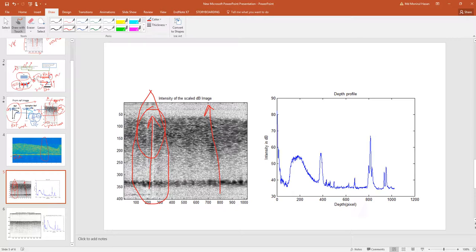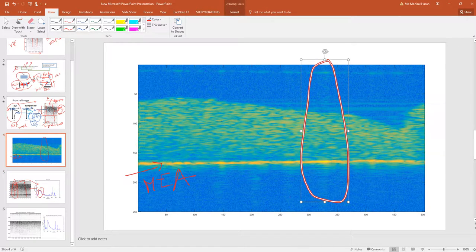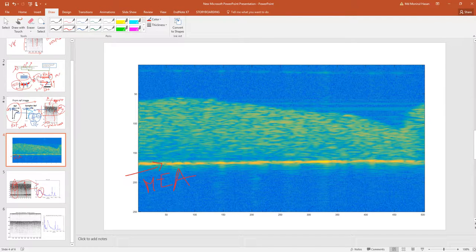If you look at the depth profile of this data, as the depth profile is an average, you get this kind of smooth graph, and there is no indication that there are streaks in the image. So we have to apply another method. So how can we do that? How can we subtract the noise in this type of image?